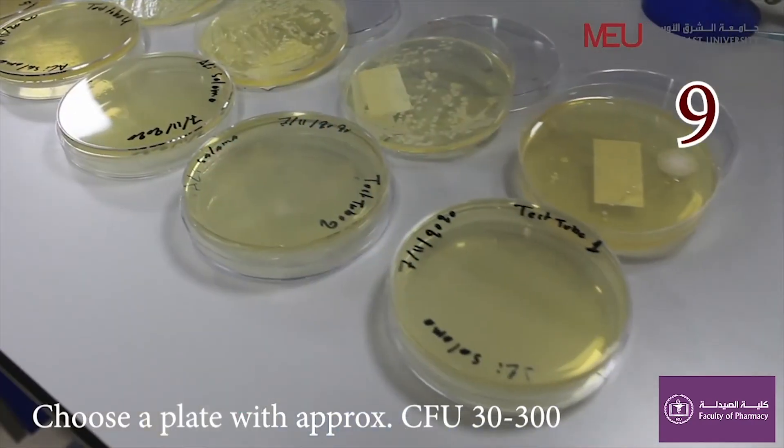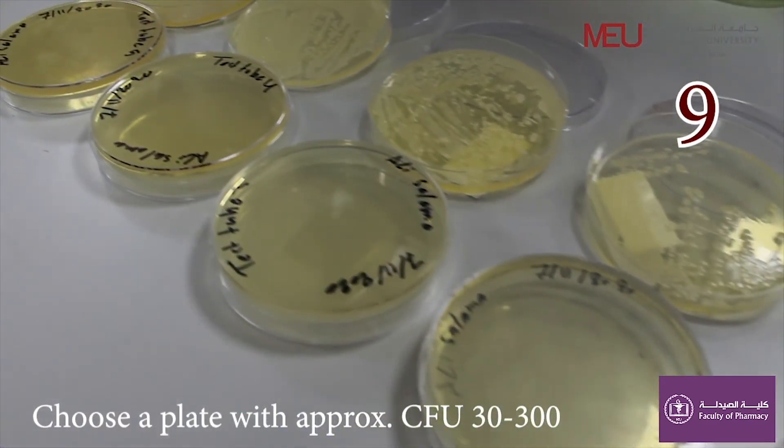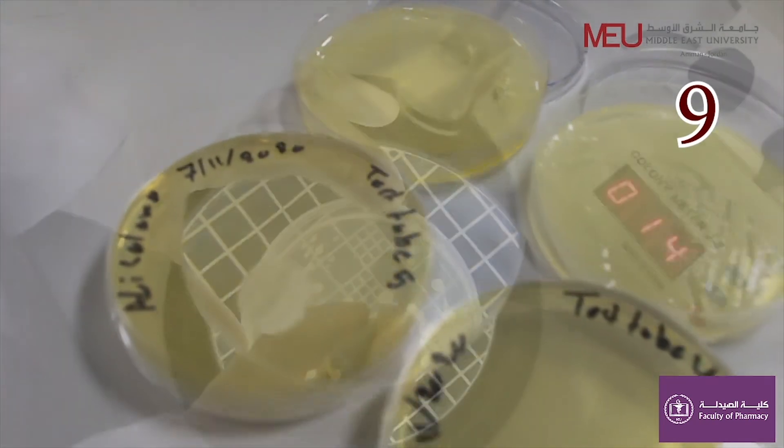Observe your results and count the colonies to calculate the concentration of bacteria in the original sample. Thank you.